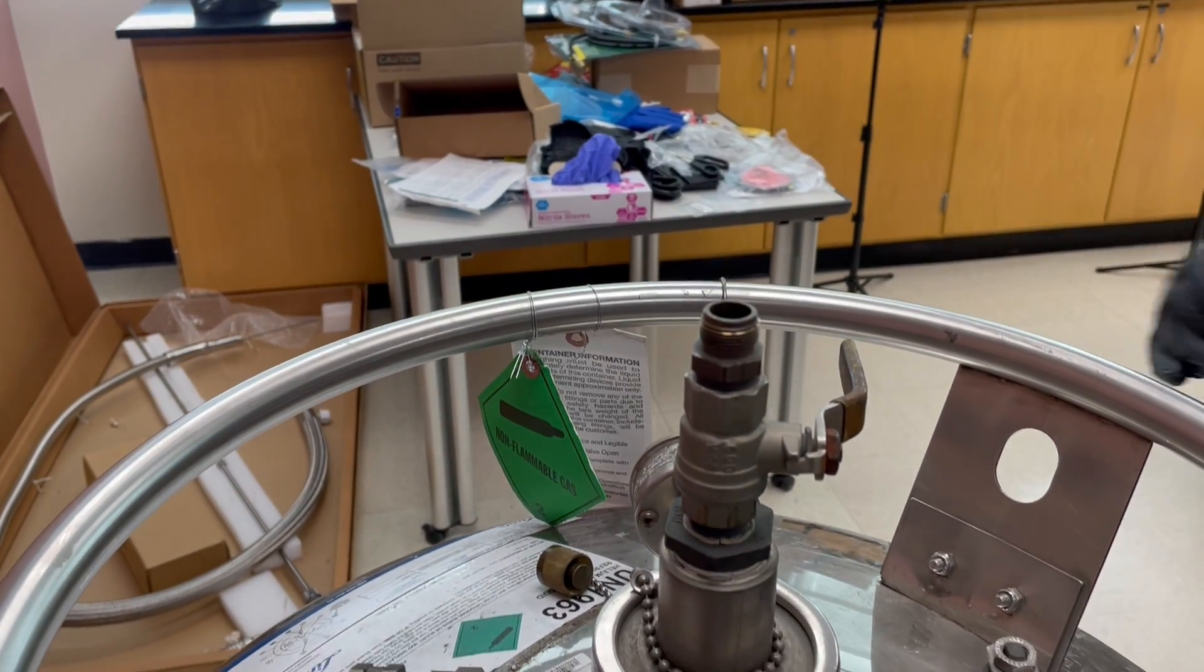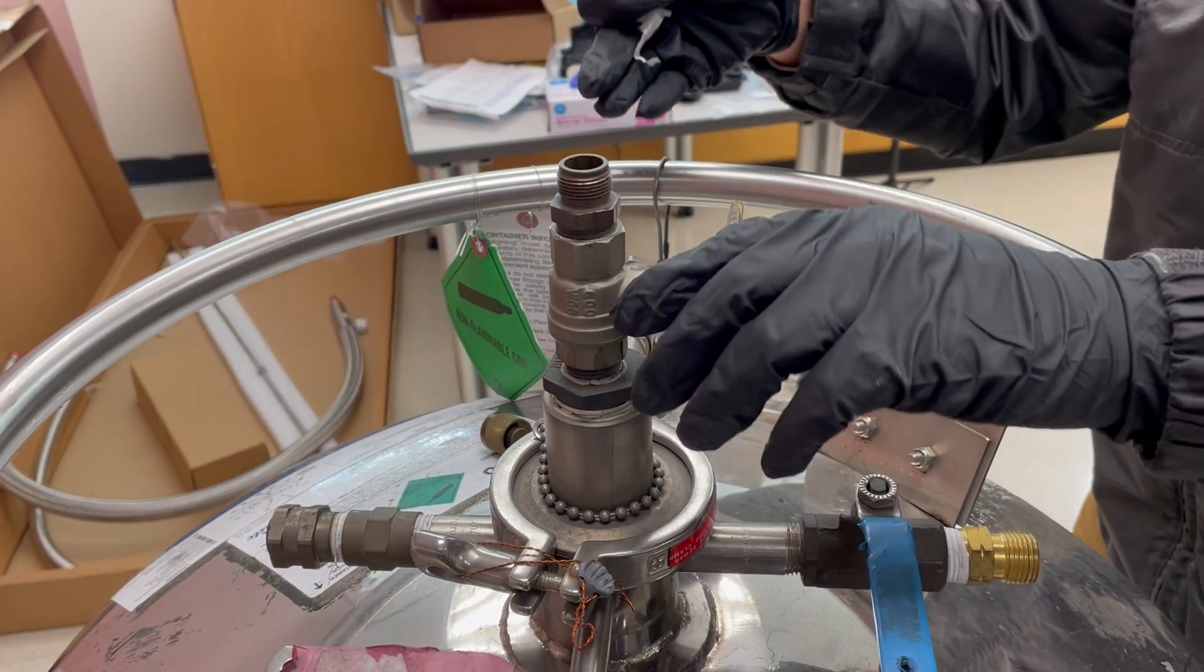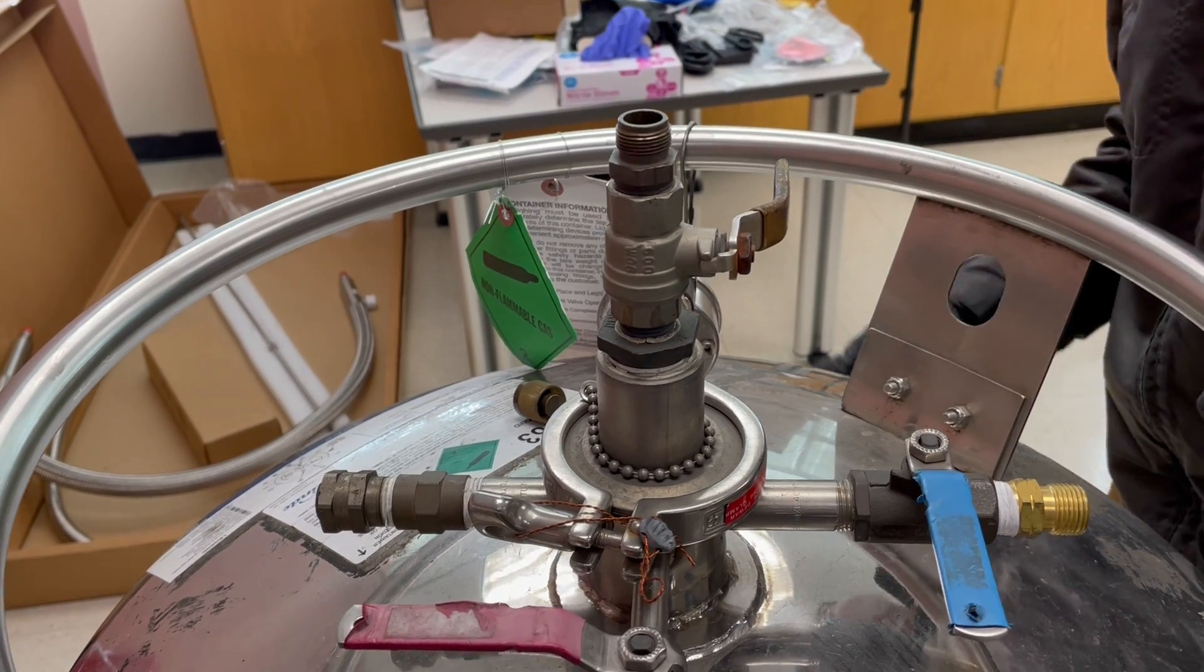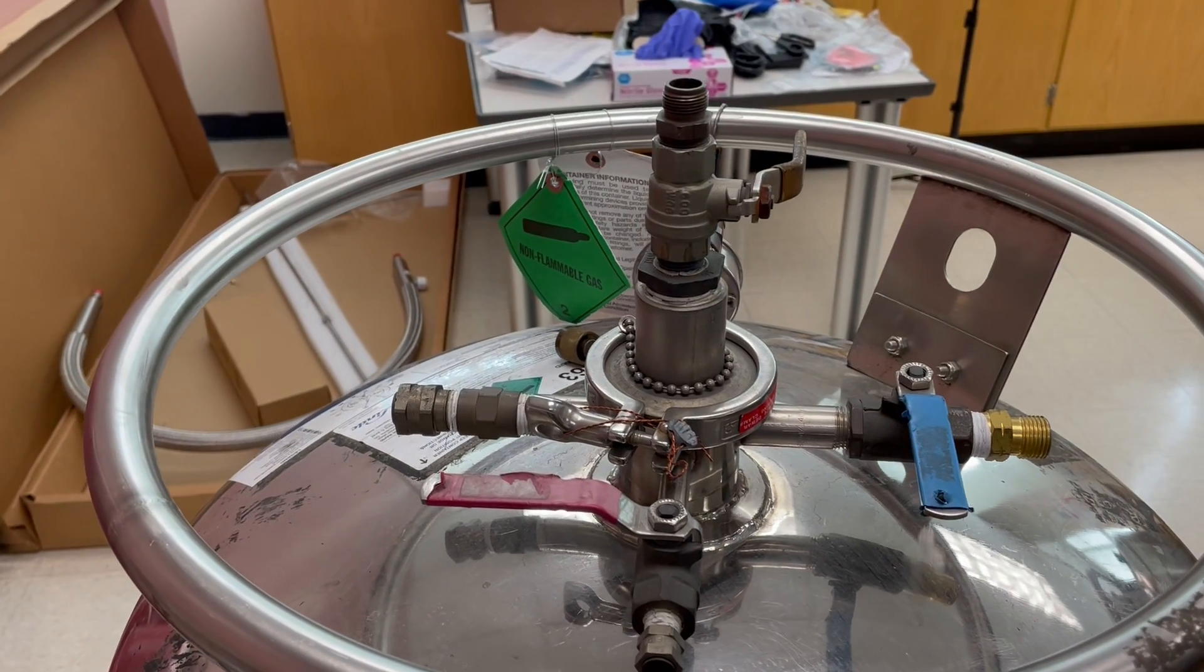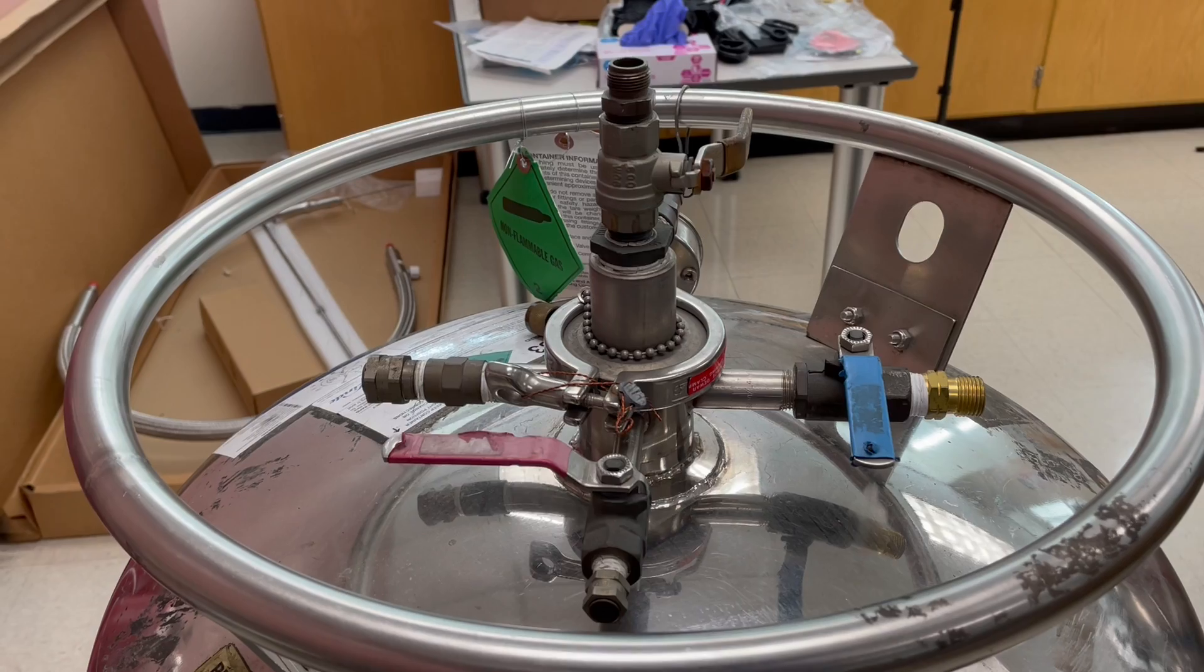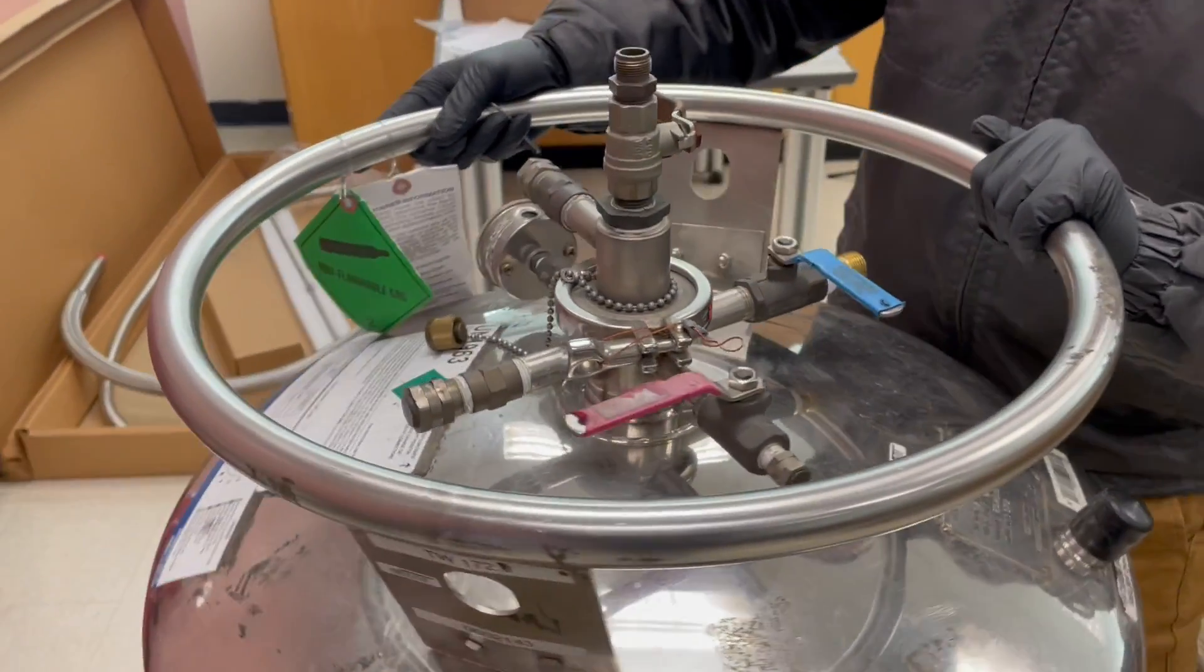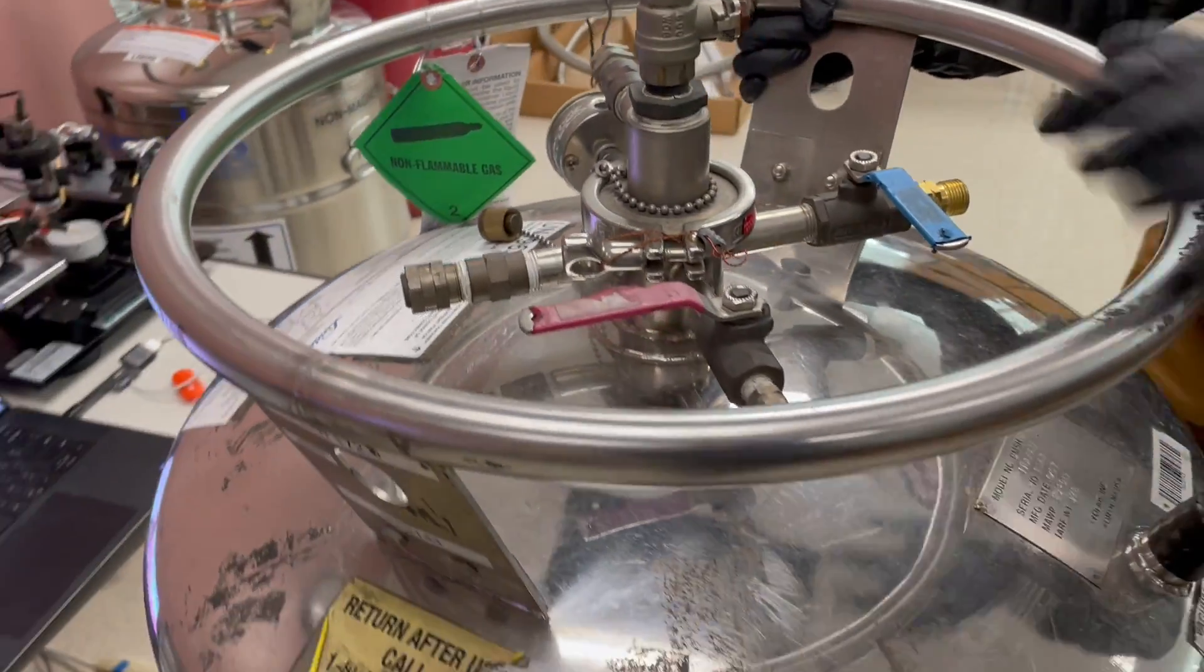So just like what we did for liquid nitrogen, we were going to insert the transfer line to here and then transfer the liquid. So we will put this one to here where we have enough area.